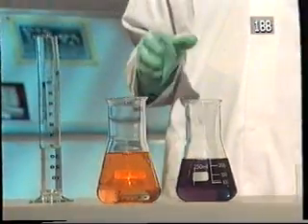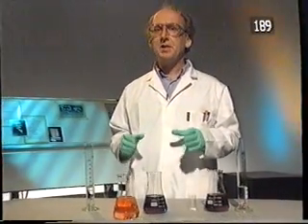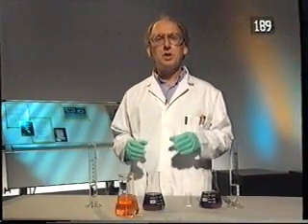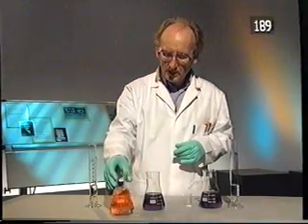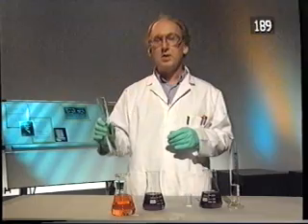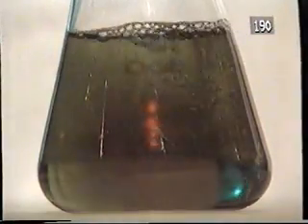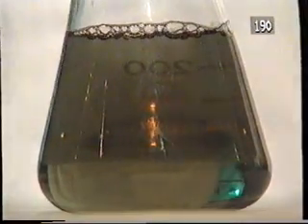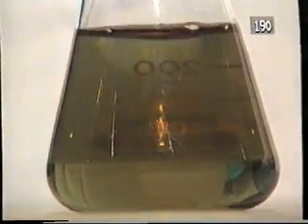Some reactions occur quite slowly if left to their own devices, but they can be speeded up by the addition of a small amount of a compound known as a catalyst. This orange-coloured solution is the final product of a reaction between hydrogen peroxide and this violet-coloured solution. Although we get a colour change, it takes about an hour or so before it finally reaches the end product, the orange-coloured solution.